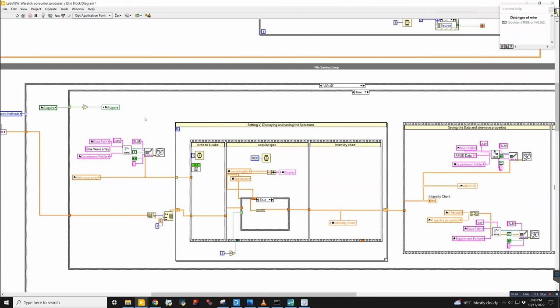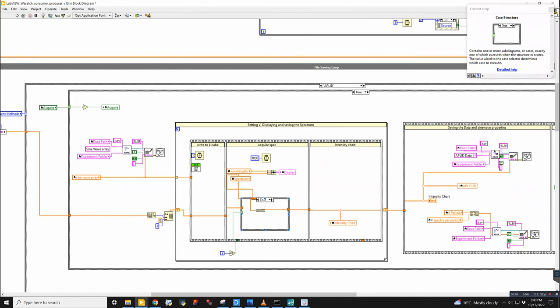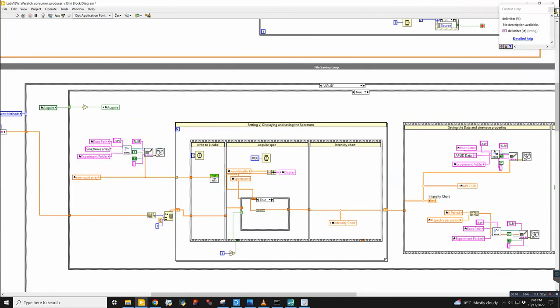Okay, so this is the applet. And the first thing that we do is generate a sine curve, because this is how we're modulating the voltage on the K cube. So we have a for loop, and what we initialize before that for loop is the sine curve. So we have a minimum and a maximum voltage that it will go to, and a number of cycles and everything. And that goes into a file here, right?